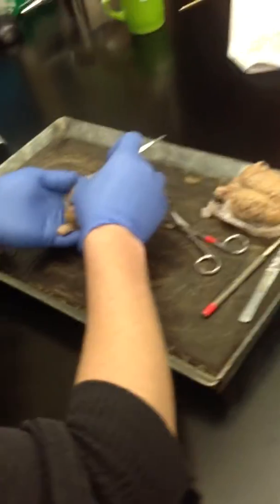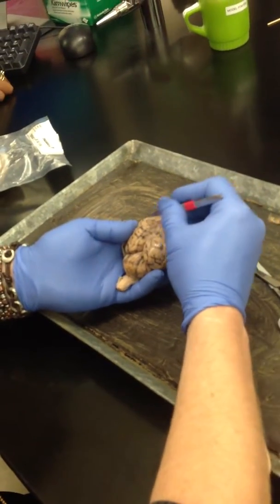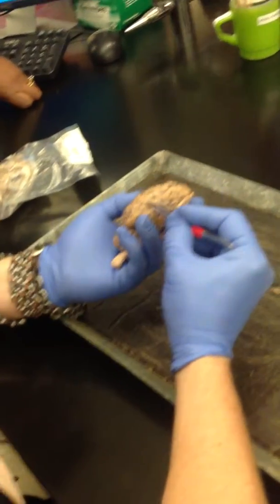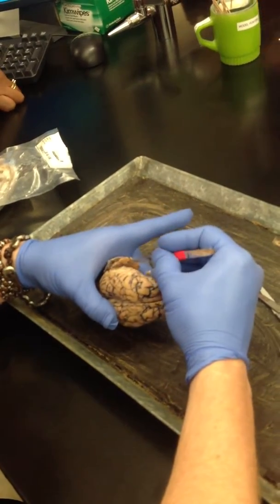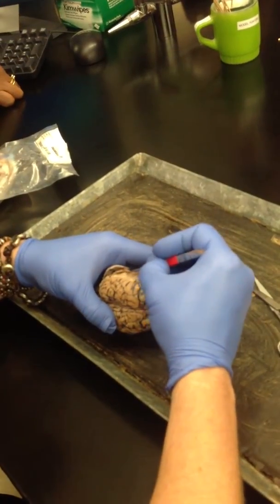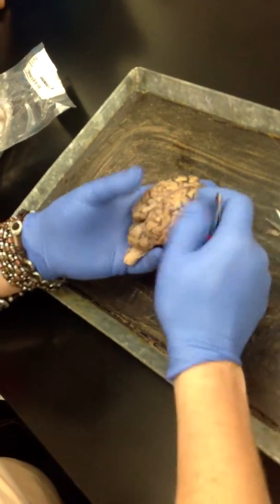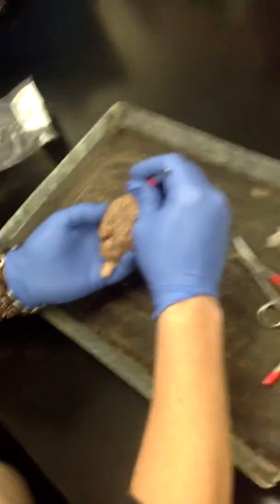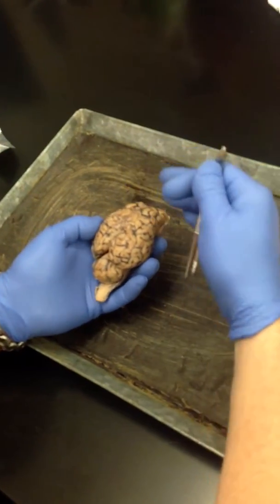Okay, so we've got the frontal lobes, the parietal lobes, the occipital lobes, and then out here on the sides, we have the temporal lobes. They did a little sliver here just so you could see the white versus gray matter, which is kind of pretty. We're not going to worry about the insula on these guys. We've got the longitudinal fissure that separates the two hemispheres. We're not going to worry about finding the central sulcus or the lateral sulcus on these guys. It's just not very clear.